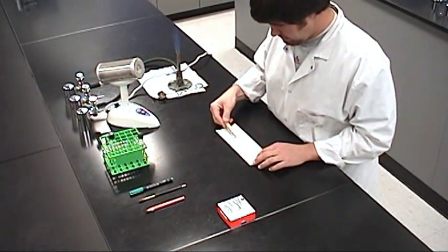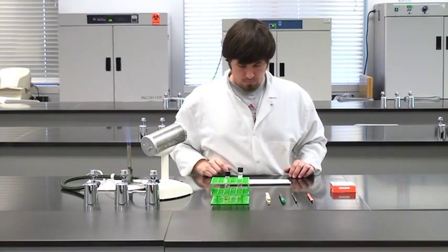The smear is now heat fixed and ready to be stained for examination under a microscope.